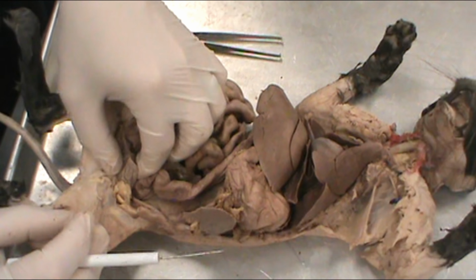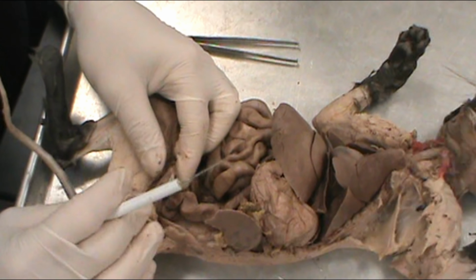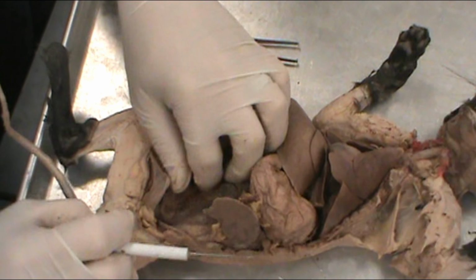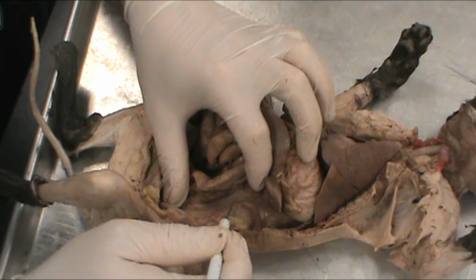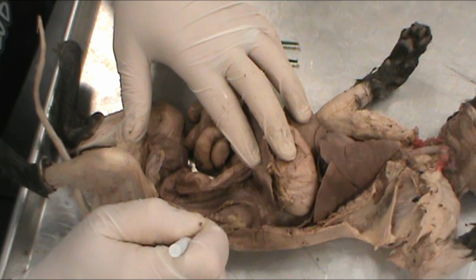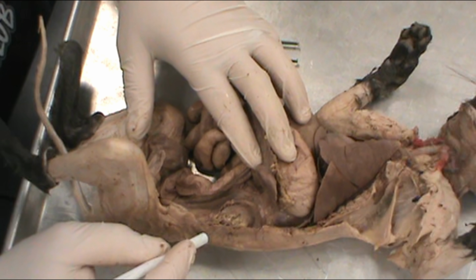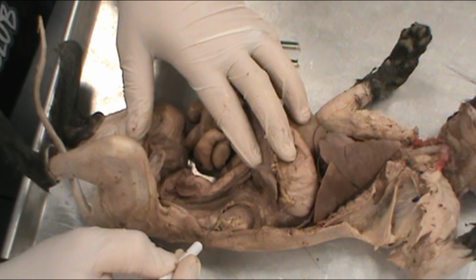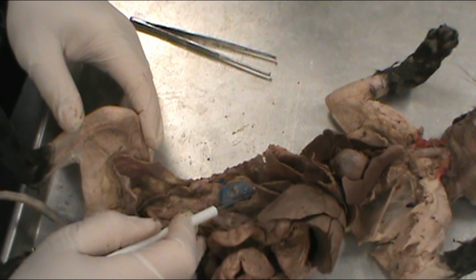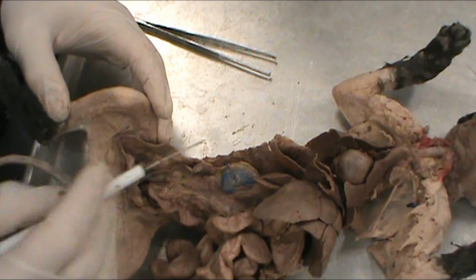So this deflated balloon looking organ here is the urinary bladder, and of course it is part of the urinary system. We come up here, everyone finds this in their cat, and they automatically assume that it is a tumor. I hear that all the time. My cat has a tumor. This is not a tumor, in the words of Arnold. It's not a tumor. This is a kidney, and you'll find one just like it over here on this side. Here's another one. That is a kidney. And again, those are part of the urinary system. So you have the two kidneys.